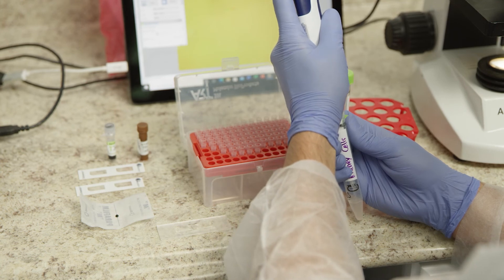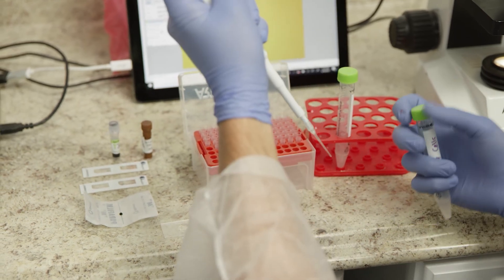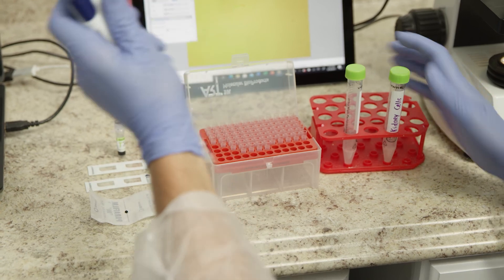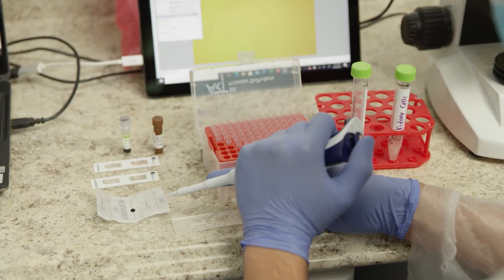Automated cell counters can be used to quantitate the yield of cells. Refer to your user manual for details on the operation of your specific cell counter.